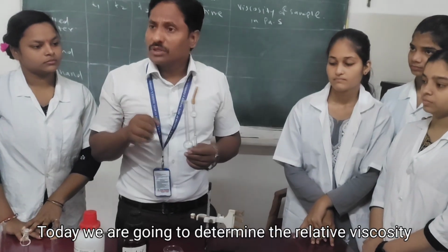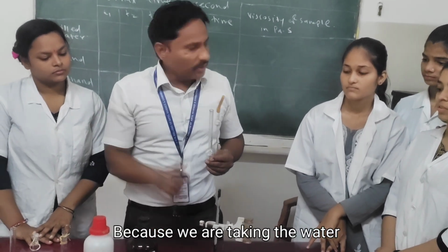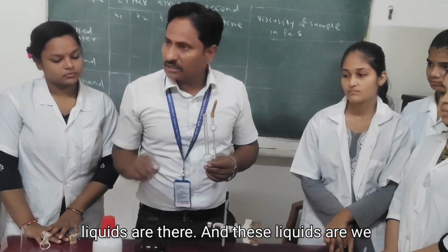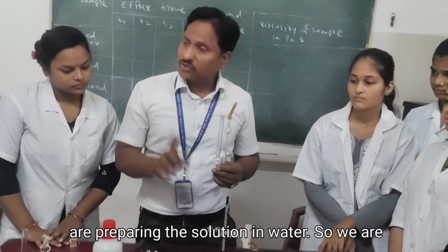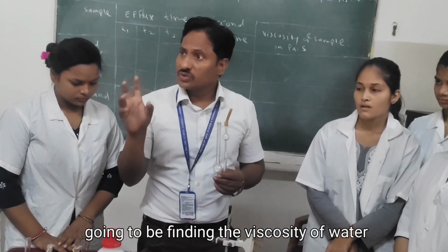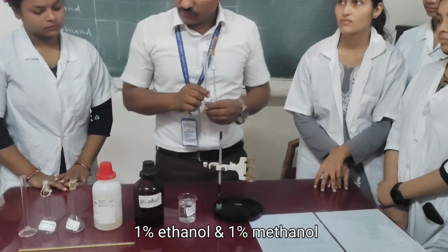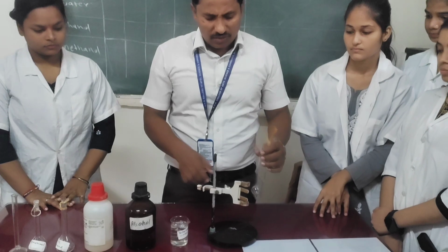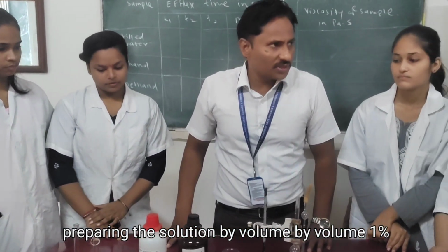Today we are going to determine the relative viscosity. Why relative viscosity? Because we are taking water as the reference and standard liquid, and the other liquids are prepared as solutions in water. So we are finding the viscosity of water-soluble liquids. Let's first prepare our 1% ethanol solution and 1% methanol solution by volume, that is, volume by volume.